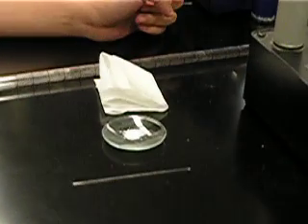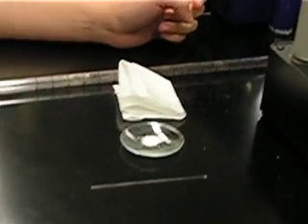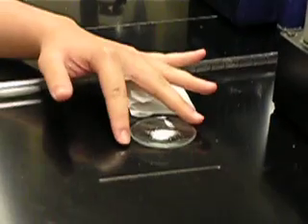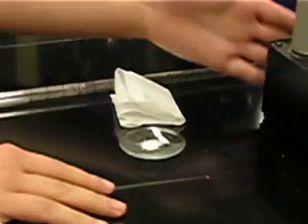Today we're going to take the melt temp of your sample to determine its identity. Here I have a graduated pipette, Kimwipe sample, capillary tube, and melt temp apparatus with a thermometer.